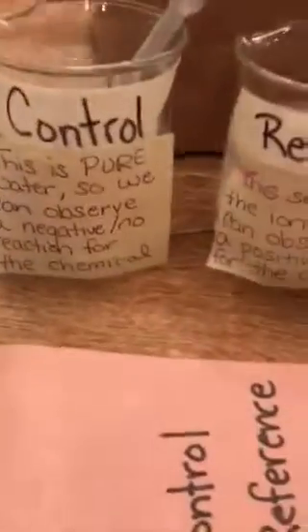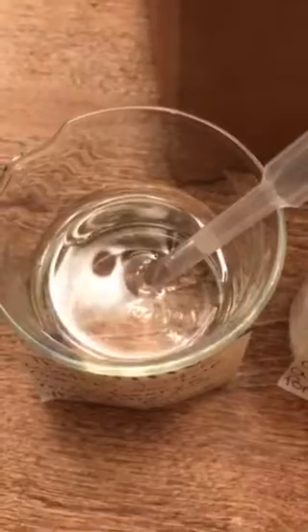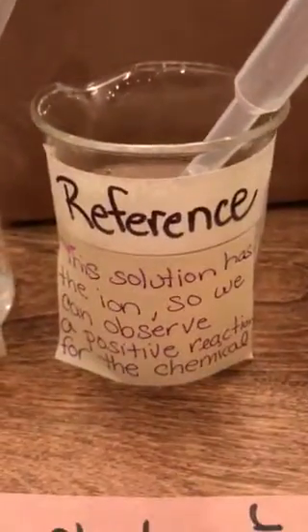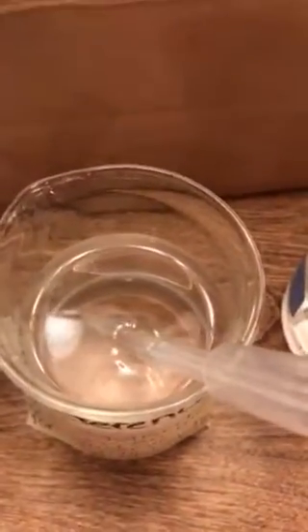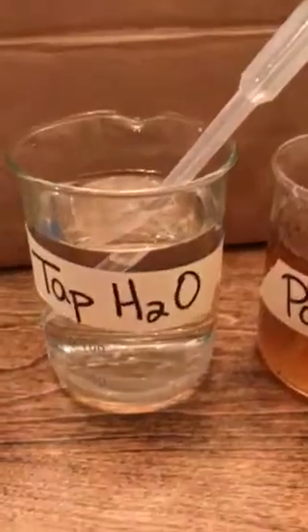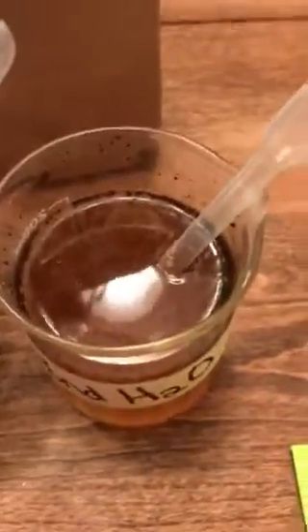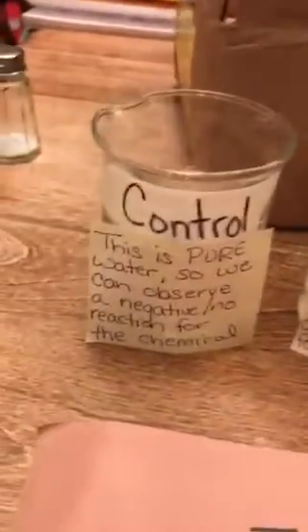So before I get started, I'm going to write down on my sheet my initial observations. The control: clear and colorless, right? It doesn't have a color and I can see through it. My reference that should have the ion in it, that's looking a little cloudy and I would say colorless. My tap water is clear and colorless, and my pond water is definitely a little on the brown side and a little cloudy.